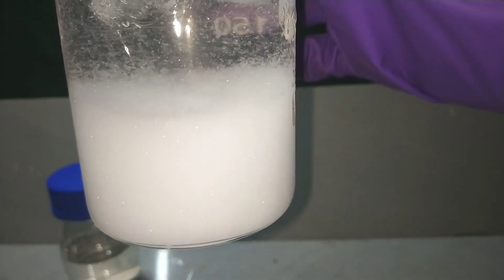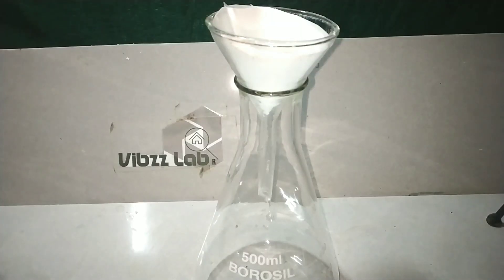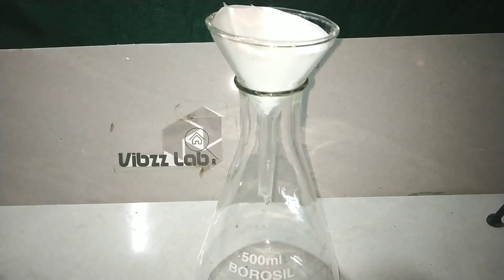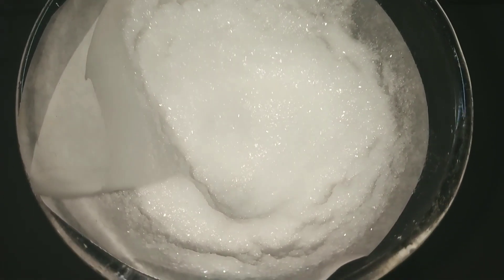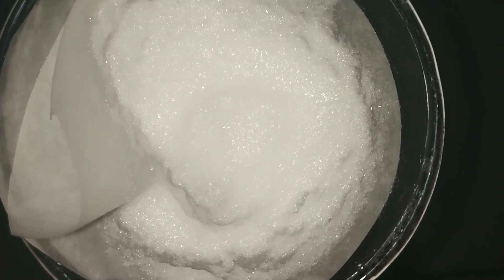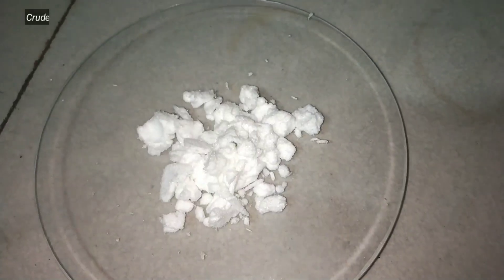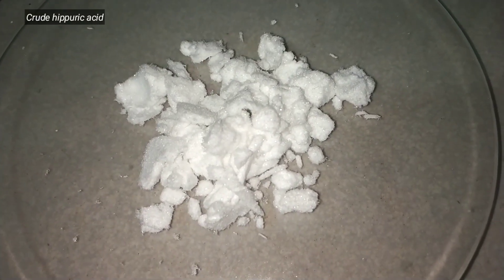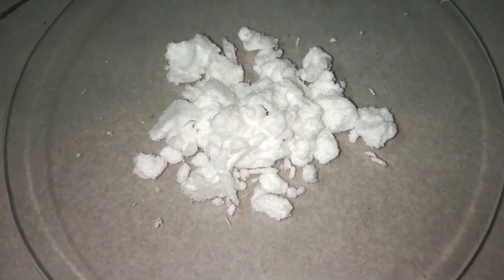Now we filter the solution and collect the crude crystals of Hippuric Acid. After filtration we get the crude Hippuric Acid as you can see here. After drying, we have these crystals of Hippuric Acid. Now we have to purify it.